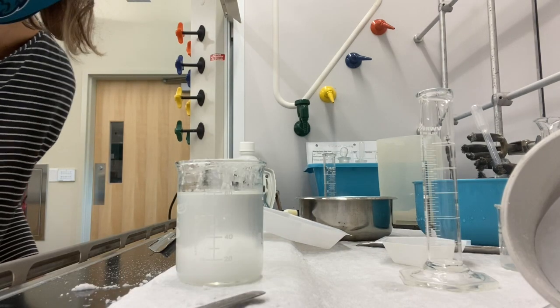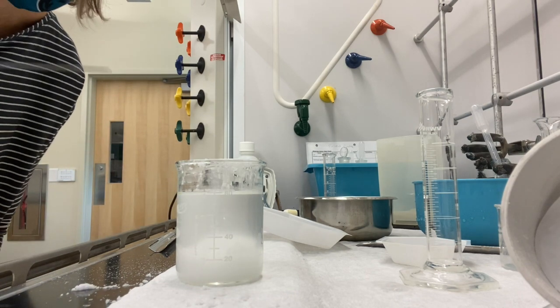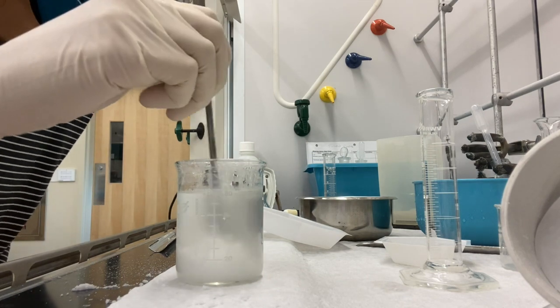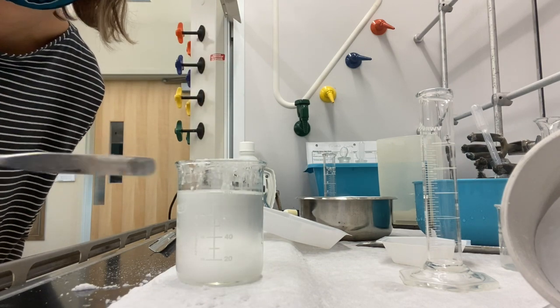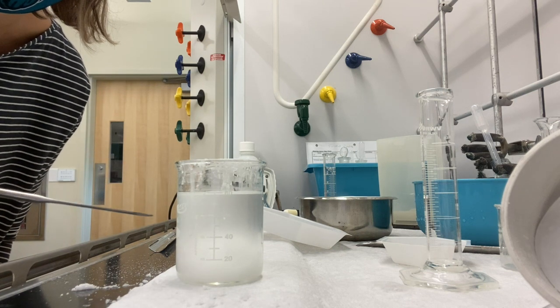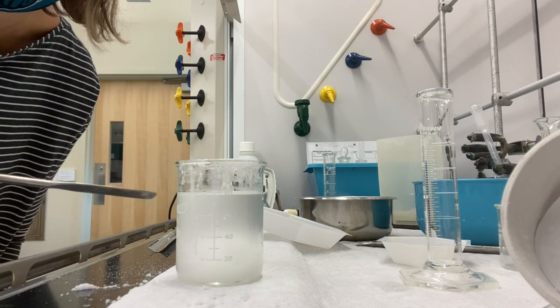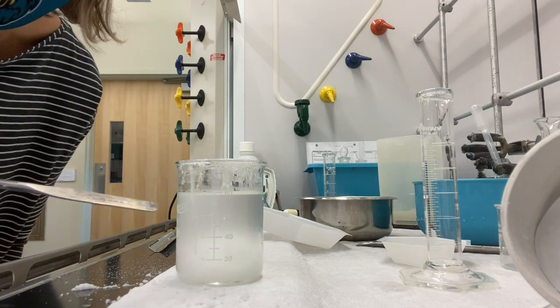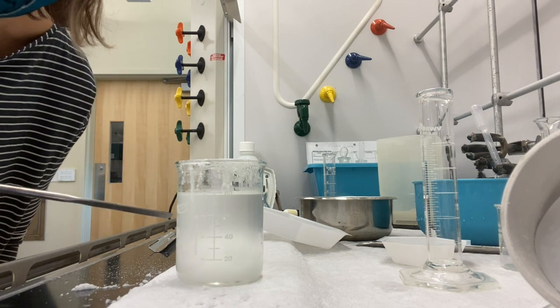So I needed to transfer the original 50 milliliters with the drying agent to a new beaker. I wanted to make sure that that cloudiness wasn't just saturation. In fact, I believe it is. As long as your solution has been sitting over the drying agent for at least, I would say, three to five minutes, then you can be assured that it's going to pull out any of that water. Typically, if it's still cloudy and you add a little bit more sodium sulfate, it'll take care of that. But I've added a lot at this point. And so we still see that we've got a lot of cloudy solution still.